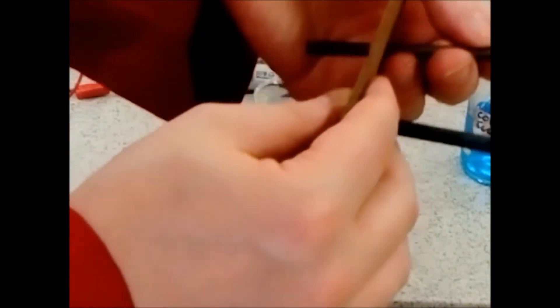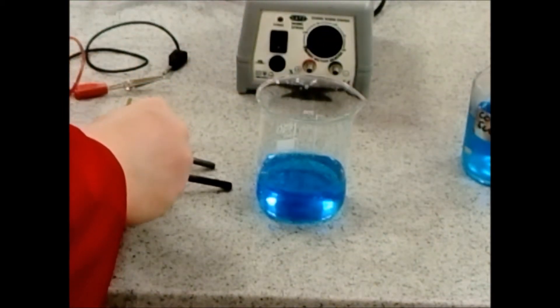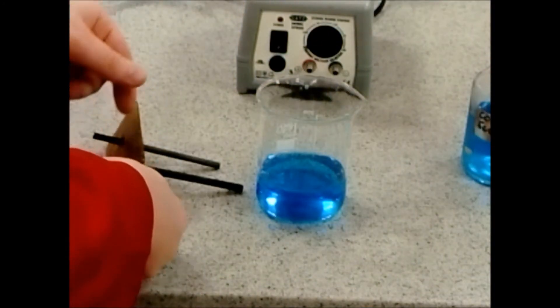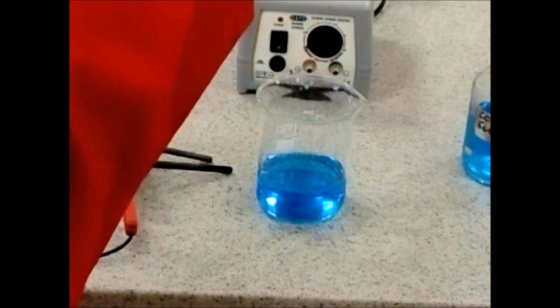Make sure your two electrodes don't touch. It's really important that they don't touch because you want the electric current to pass through the electrolyte, not straight through the electrodes. After you've done that, before placing in the crocodile clips, clip them in place — this is how you connect to the power pack and it stops the electrodes from slipping out.